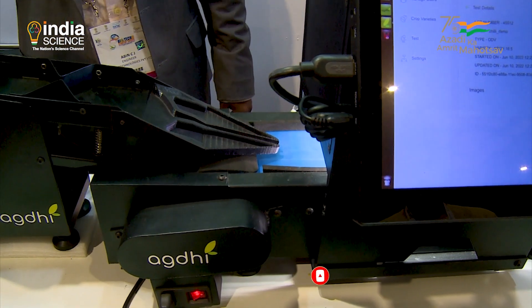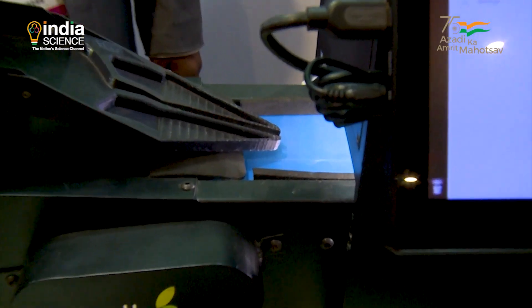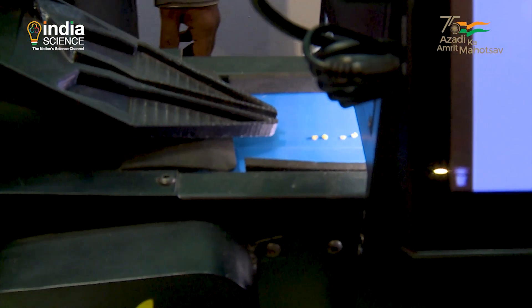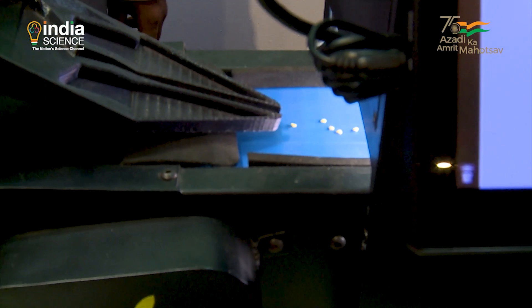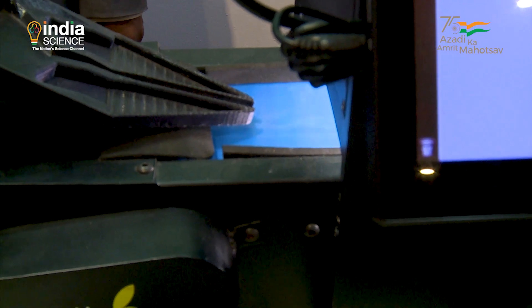Our system can identify between hybrid and female as well. Physically, humans cannot distinguish that — either they go for a GOT test or a DNA test. Through our system, we are able to determine that.